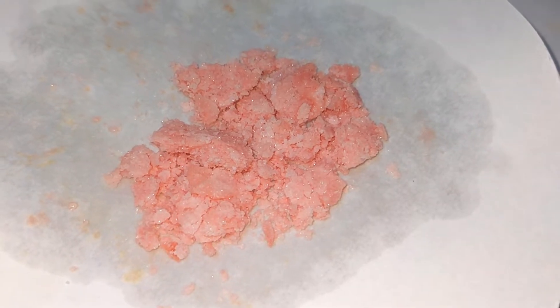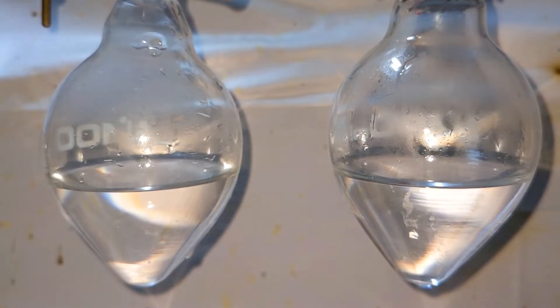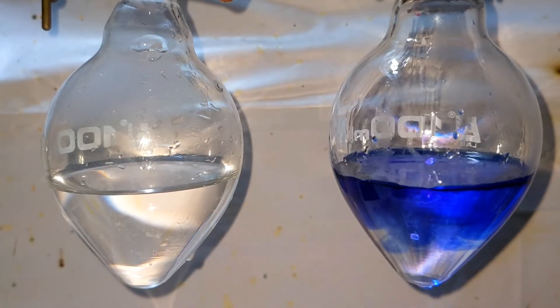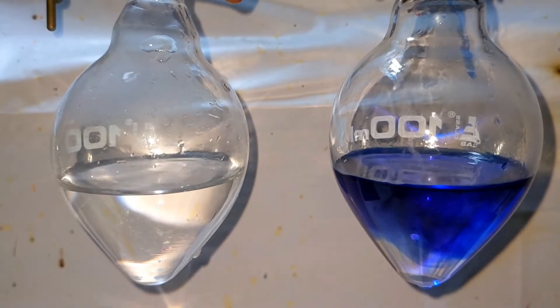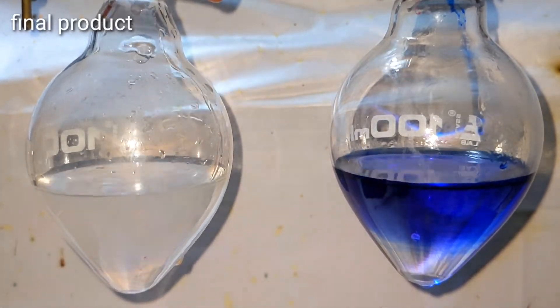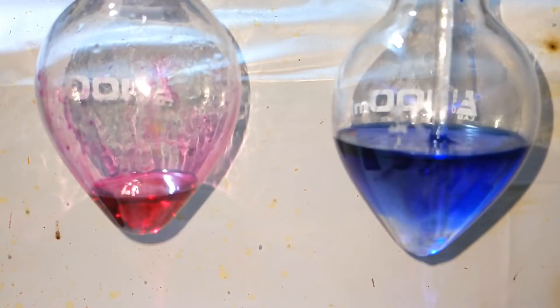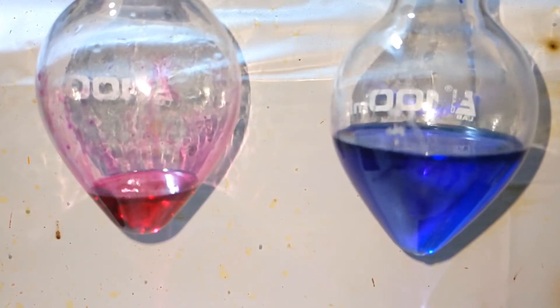To test it, a small amount of thymolphthalein was dissolved in ethanol. We have two pear-shaped flasks: on the right we have concentrated sodium hydroxide solution and on the left we have water. On adding thymolphthalein to the sodium hydroxide solution, a beautiful blue color is produced. In water, thymolphthalein is colorless. On the left side we have concentrated 98% sulfuric acid, and thymolphthalein gave a purple color, indicating the pH is less than zero.